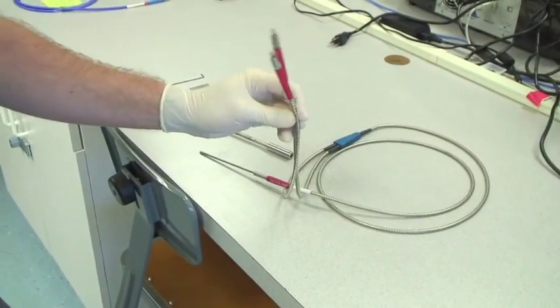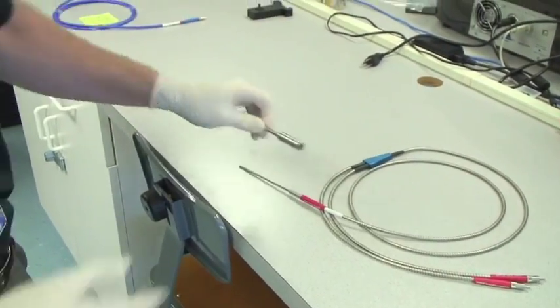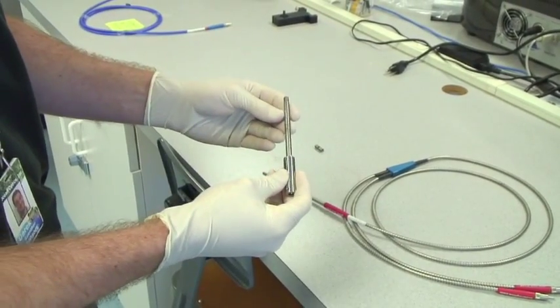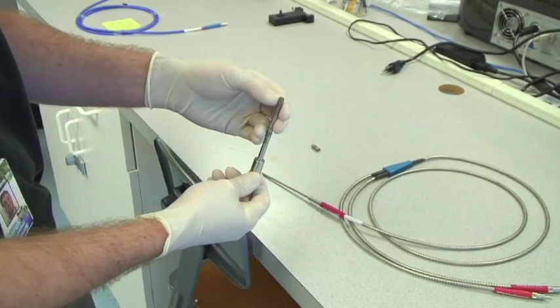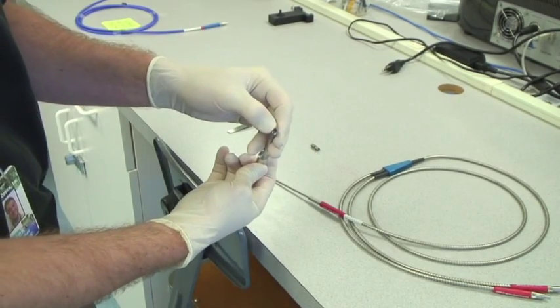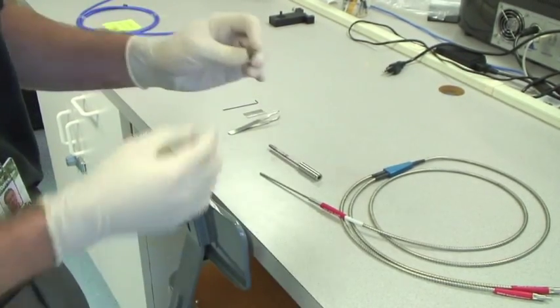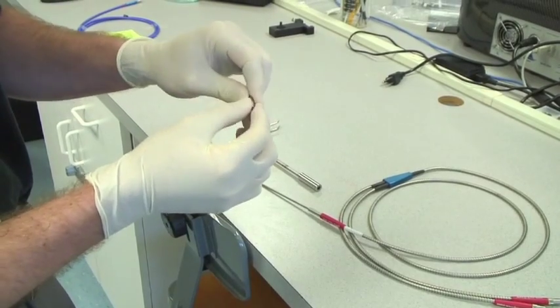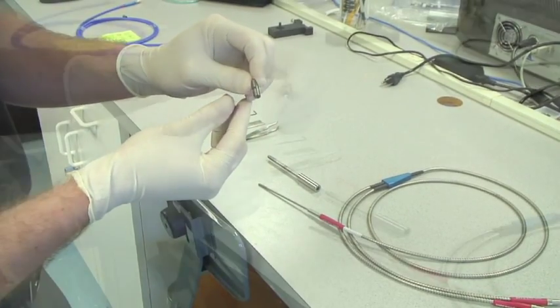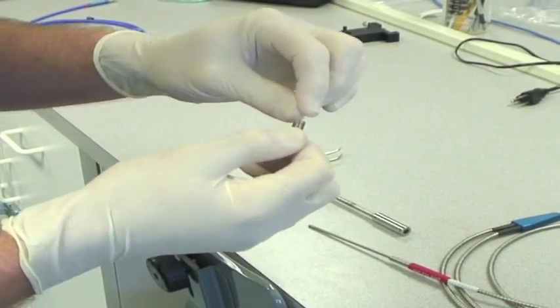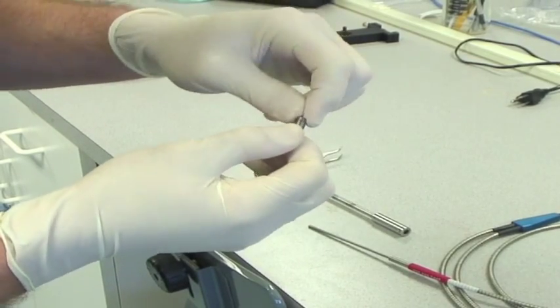We have the main ferrule - this is what we're going to attach the pH patch to with the lens tip right here - and then the mirrored tip. This is the tip that screws on the end and there's a mirror inside of it.